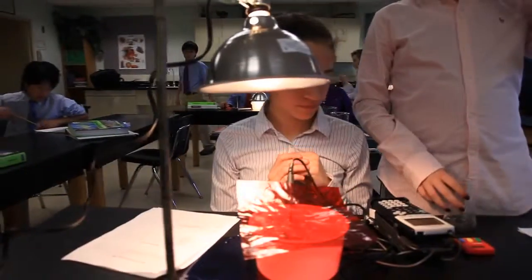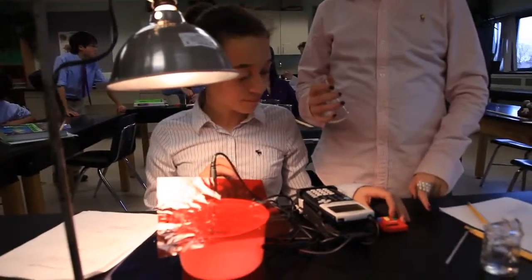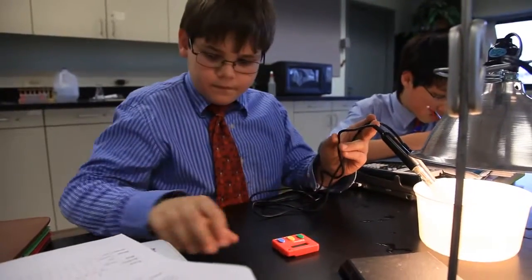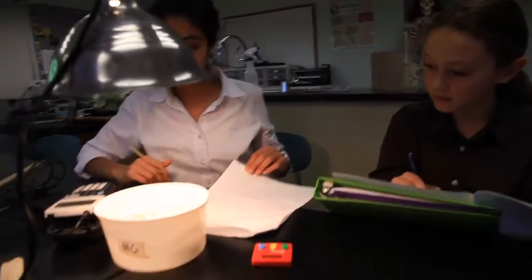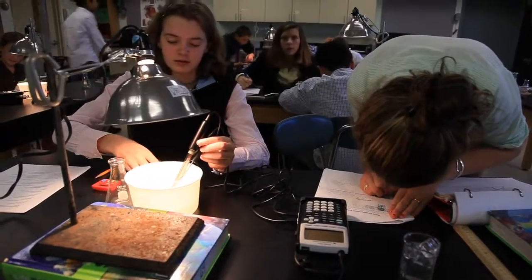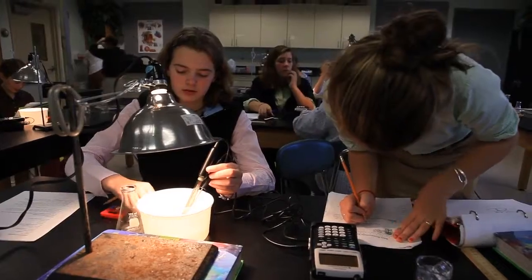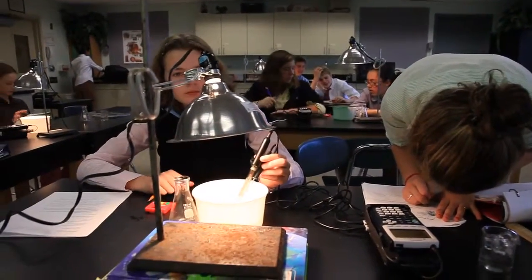My students were looking forward to this particular unit because they were able to use probeware that normally would be used at a high school level. So they saw the technology that they were going to have in their hands, and they were able to use it instead of using your typical pH paper, which is more laborsome and more time consuming. This was an immediate read. We could also immediately put it into a graph where you could see your results more clearly and efficiently.